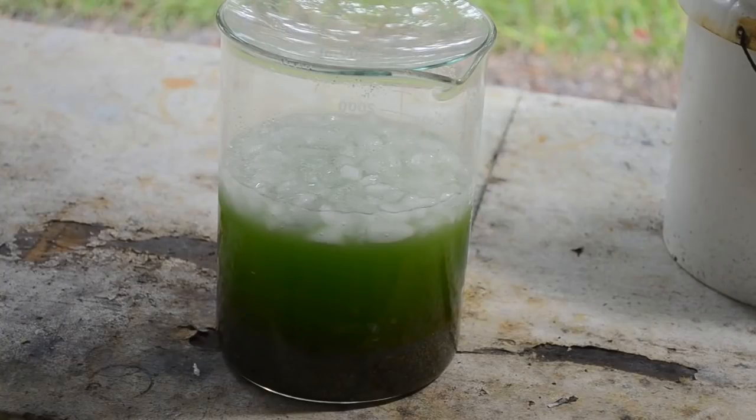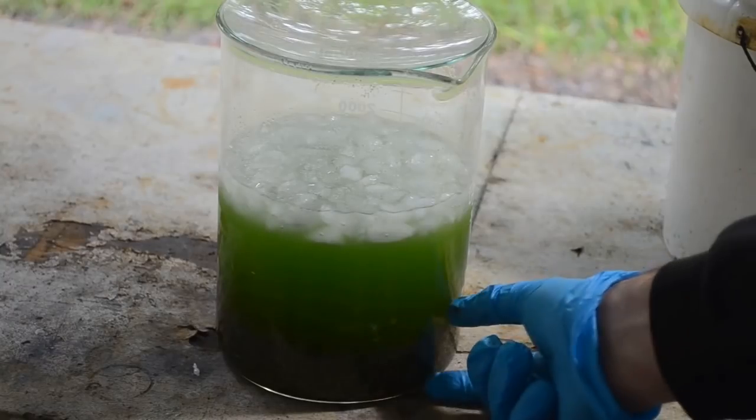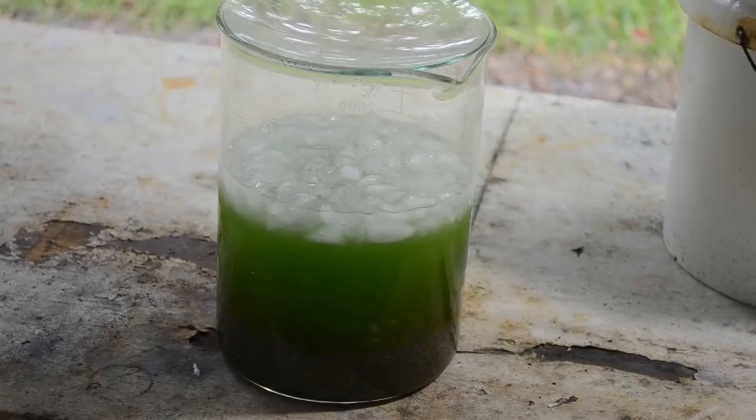From the deep green color, apparently there was still some copper left in there too. It's really hard to get all of the metals dissolved out of so much material. So I think I will set up the sluice to do the second batch, just so that I can reduce the amount of material. I'll be able to concentrate the gold into a smaller amount of material, and the acid extraction should go a little easier, I'm thinking. So yeah. Ooh, I may wait for a warmer day though. It is chilly today. No water sports today.